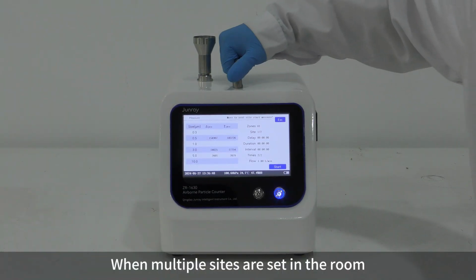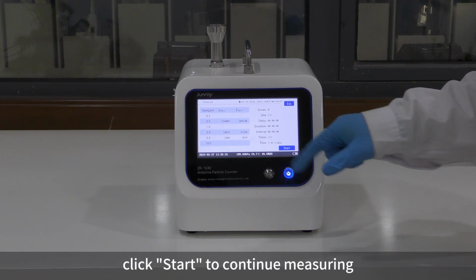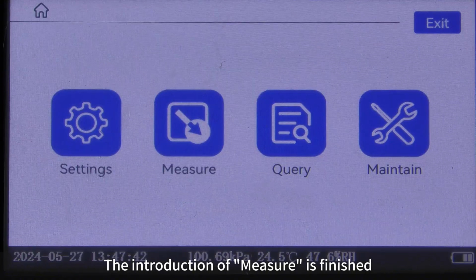When multiple sites are set in the room, the instrument will display move to the next site after each point is measured. At the next point, click Start to continue measuring. The introduction of measure is finished.